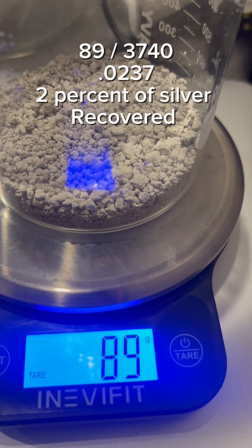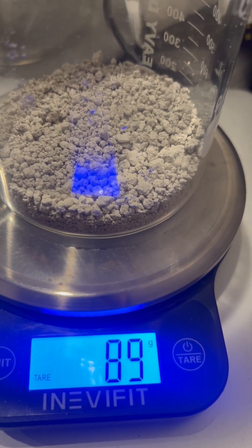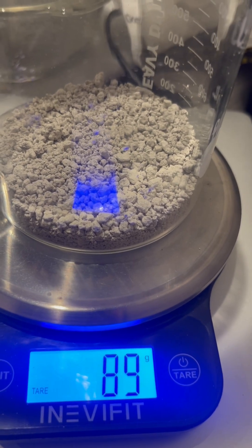So let's weigh it out, and that is 89 grams of cemented silver from this project.